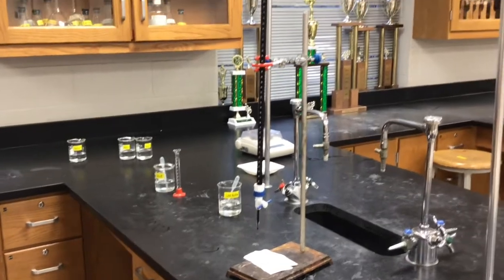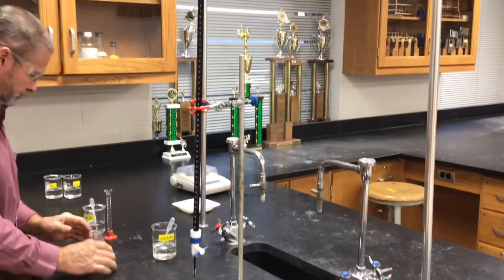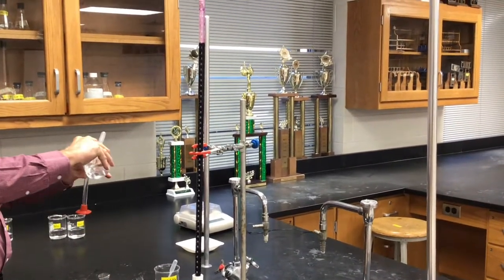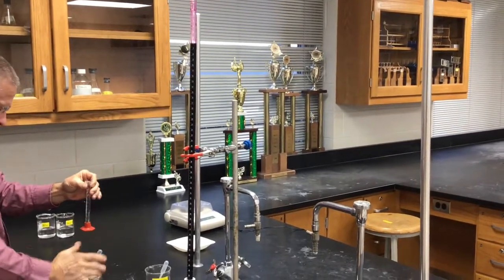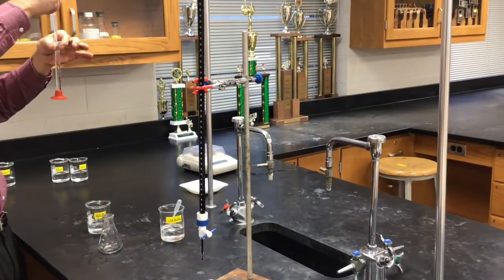Manganese, like a lot of transition metals, is cool because different oxidation numbers of it will give you different colors. Manganese, when it's in permanganate, is this beautiful purple color, but when it's Mn+2, it has no color. That's why as soon as it hits the peroxide, it goes clear.